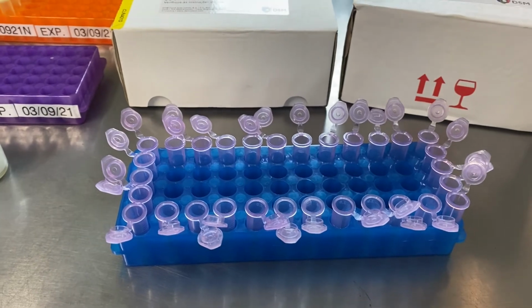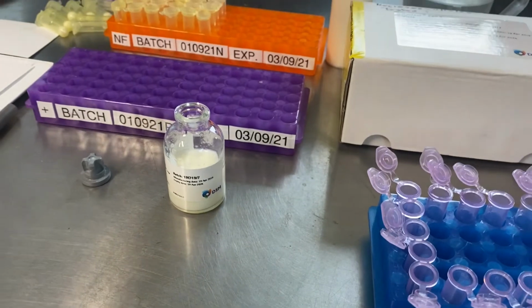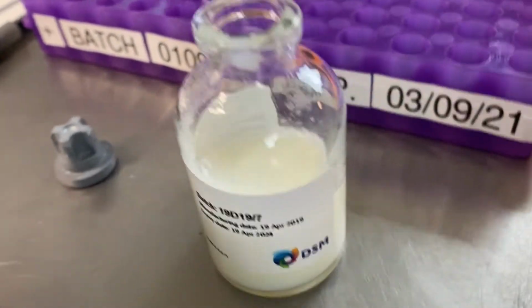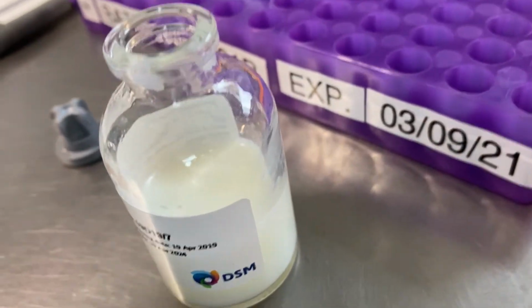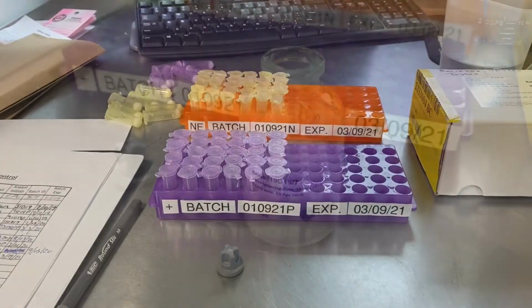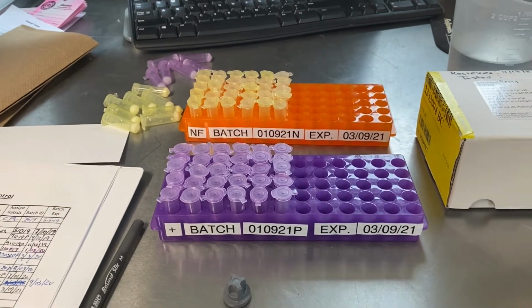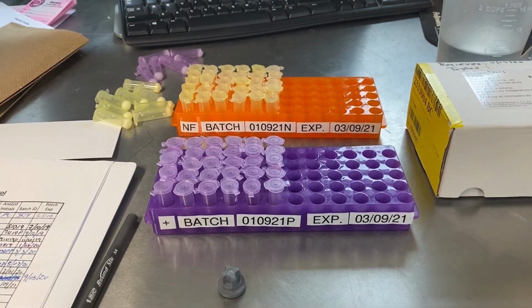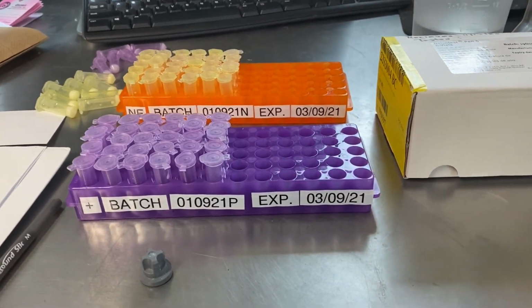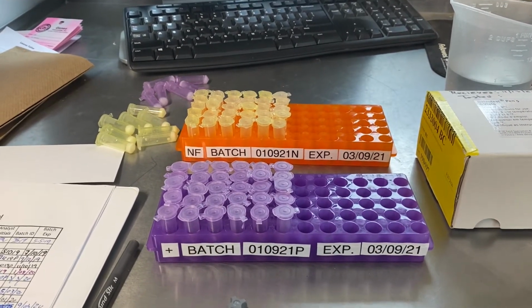We're ready to start doing our positive control, and we're going to do the same procedure as we did before using our pipetter and now our recently agitated and completely mixed sample vial of the Pen 5 sample. All right, so that's it for the making of the controls. These now move into the freezer. We can use these up to 2 months from now. March the 9th, we need to be making new controls by then.